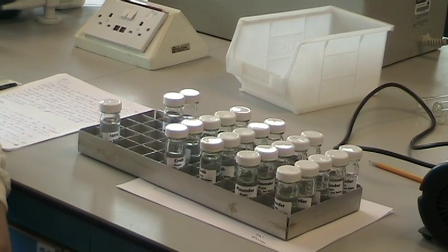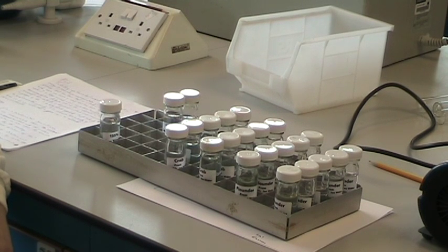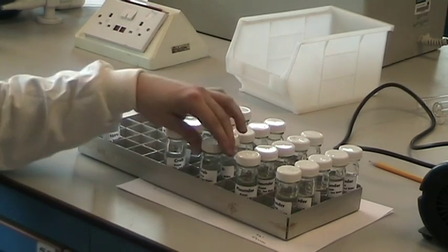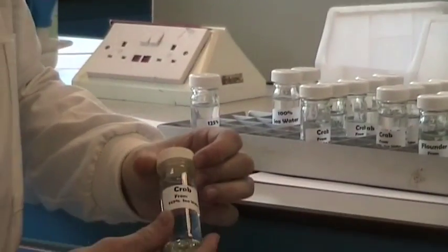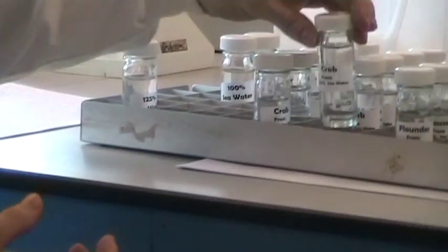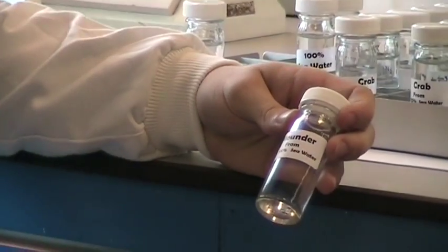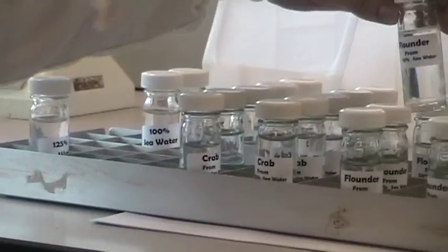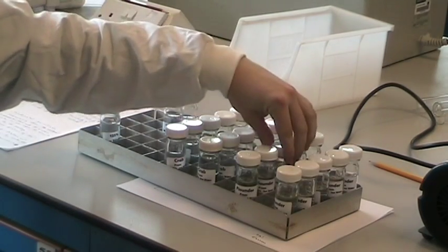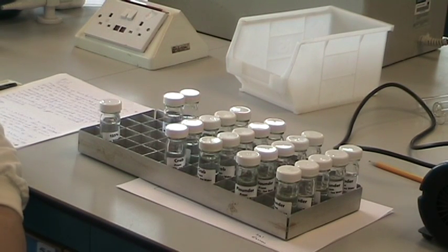To do this experiment, we have kept animals in tanks with a range of salinities for several weeks and collected their extracellular fluids. For example, we have a crab extracellular fluid kept from 125% sea water concentration, and extracellular fluid from a flounder at 75% sea water concentration. These animals will have been employing whatever osmoregulatory strategies are at their disposal.